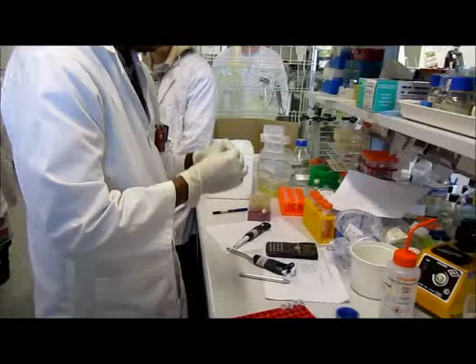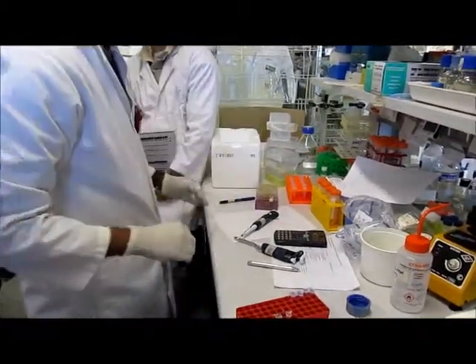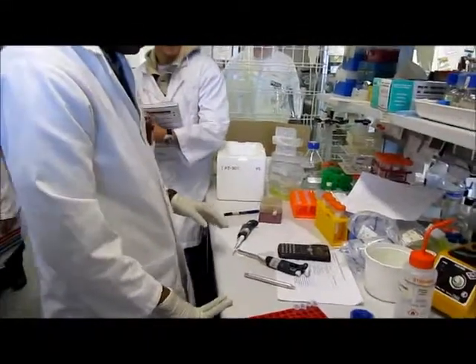Can somebody write down all the materials we're using? I'm just gonna list it. Oh, can I? The amount. Oh, okay, no worries. Yeah.